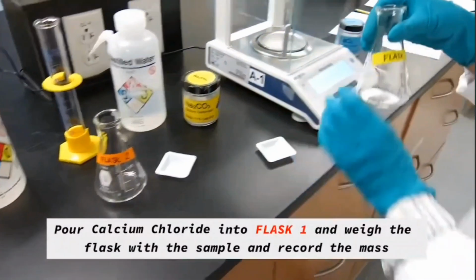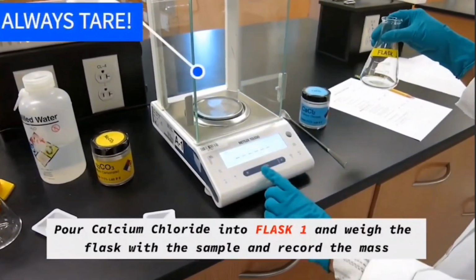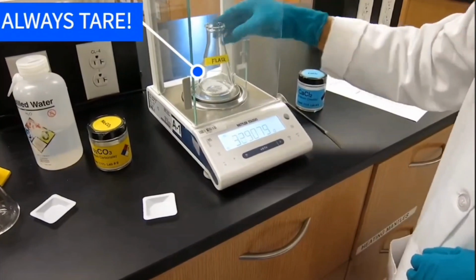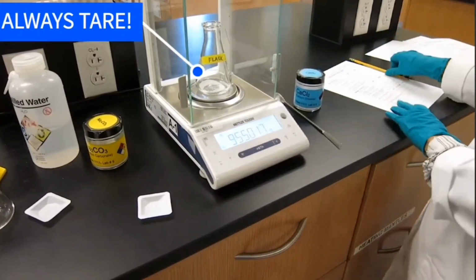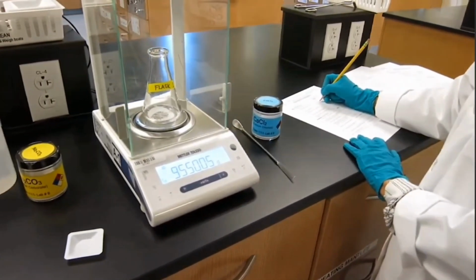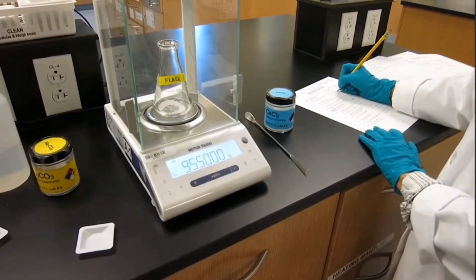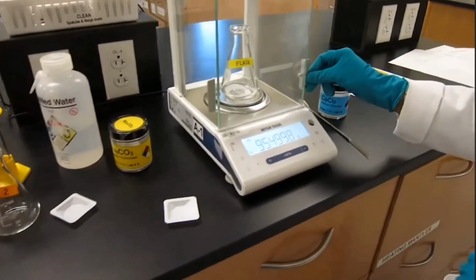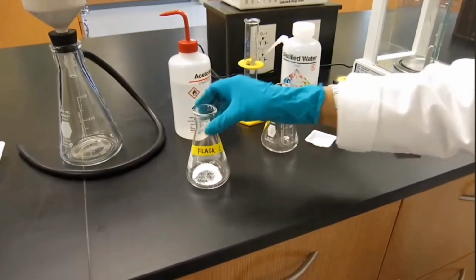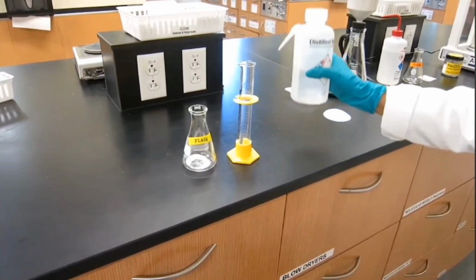After you pour it, you're going to get the mass of the flask 1 and calcium chloride, and make sure to zero the balance before you put your flask on again. Write down all the significant figures that the balance gives you, and that is your flask 1, and this is for the first trial. We will be doing 2 trials, and this is the first trial.